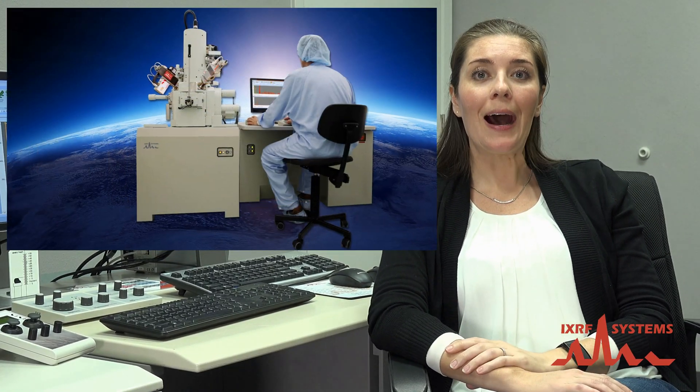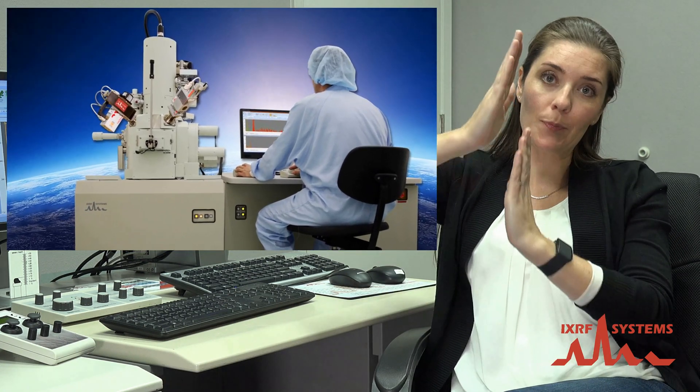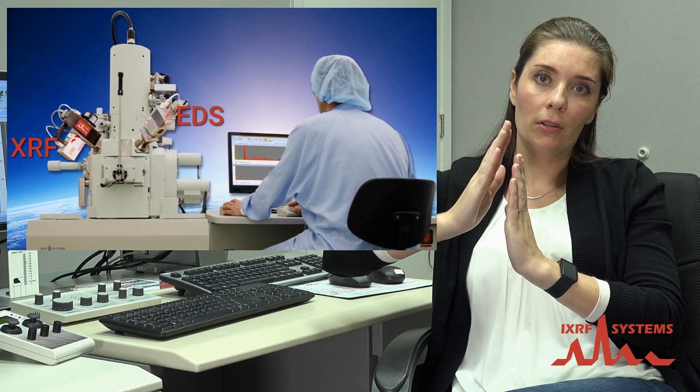So what is required to add an XRF source to your SEM? What we need is an open port — a place where we can put on that XRF source. A WDS port is best or a high-angle port. It's nice to have that big space on the side of the scope. We can work with other ports, but high angle is best.